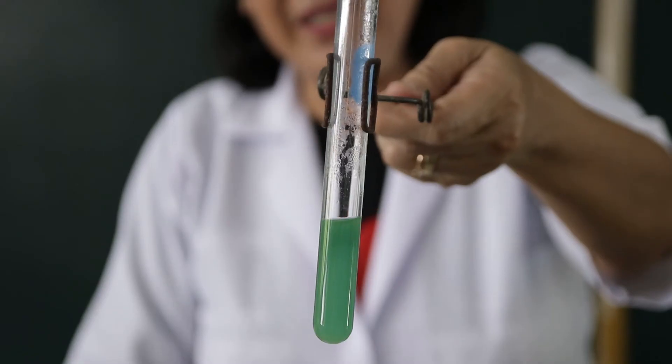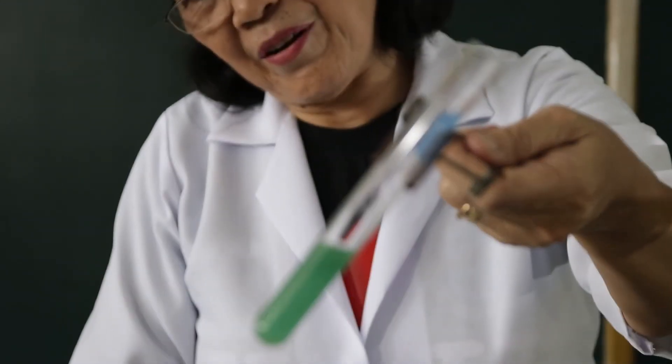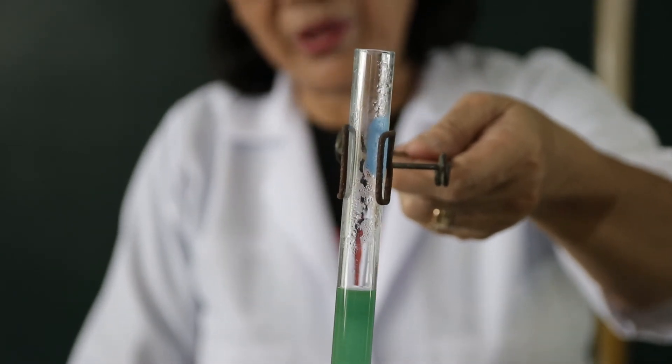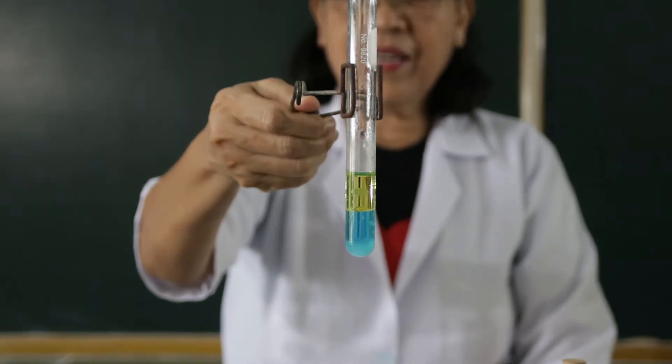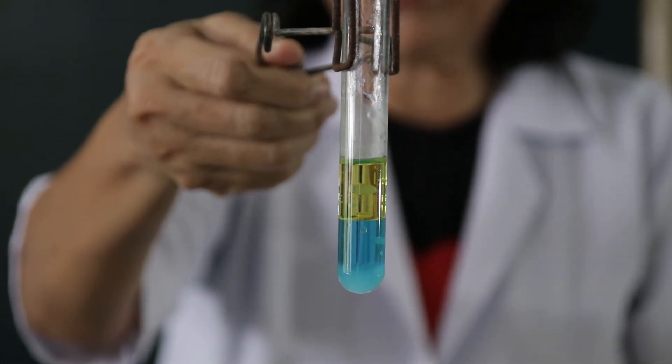I would like you to observe what happens to the color. This is the formaldehyde added with the Fehling's reagent. Observe what happens to the color before it was heated in the water bath. Then this is the benzaldehyde added with the Fehling's reagent and placed in the water bath.